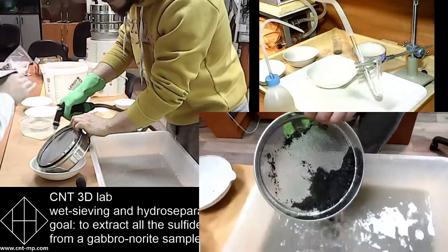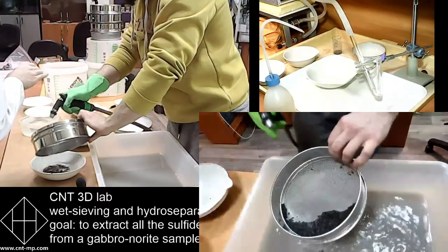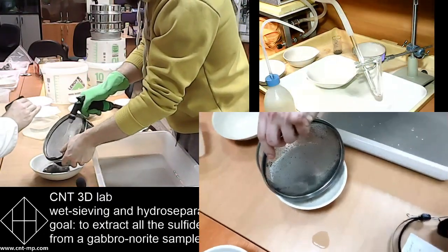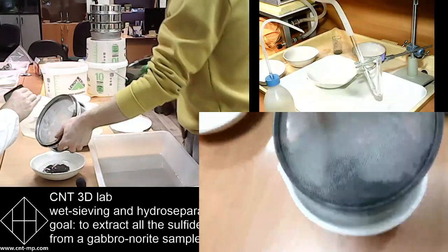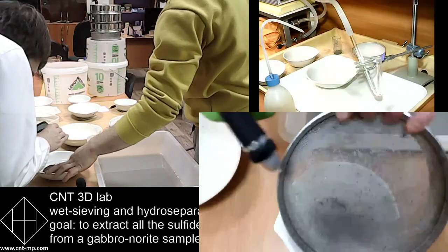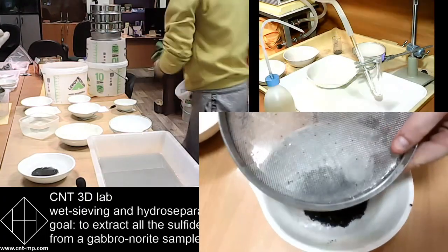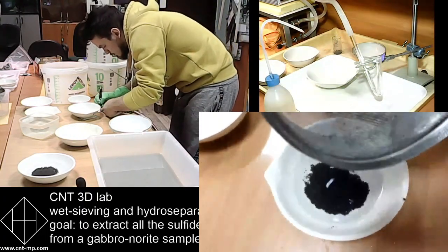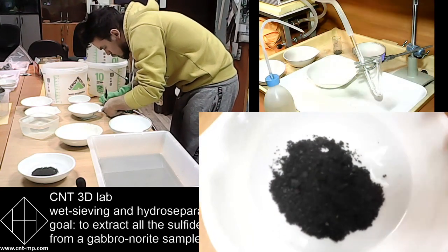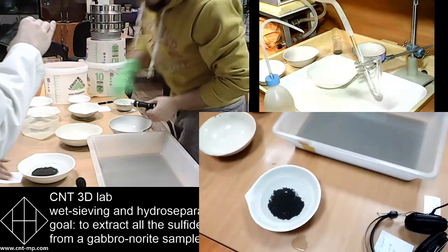Supposedly it's now being processed. And he rejects all +1 into a separate dish. So now we have -1 and +1 separate. So this amount is +1 mm. We don't work with it. We reject it from balance because that weight can be deducted from the weight of the sample. It's all the same sample.